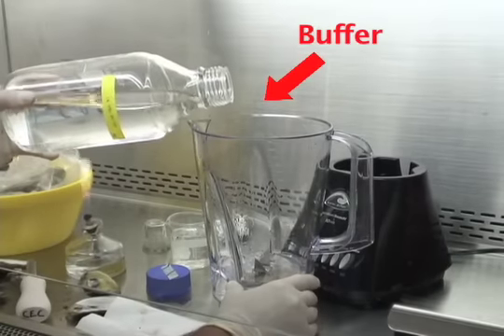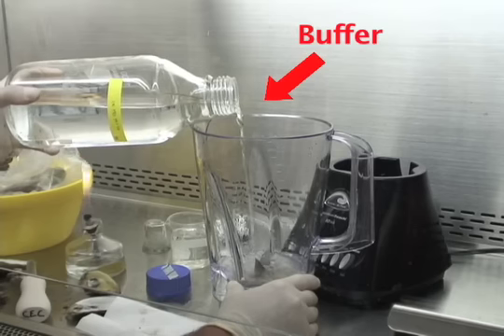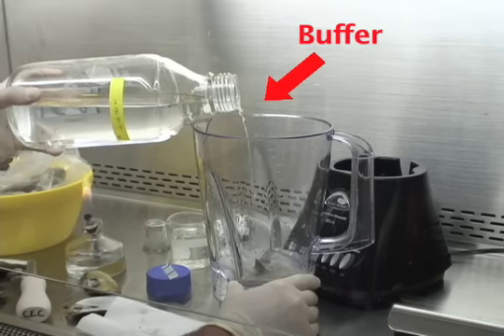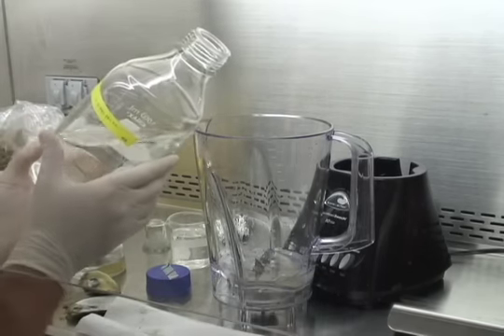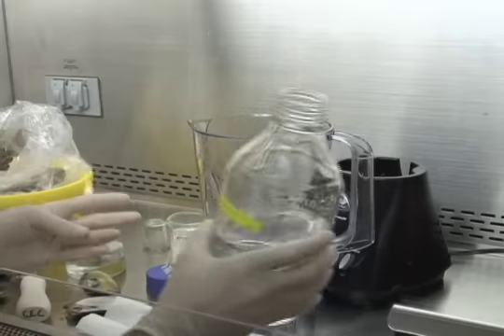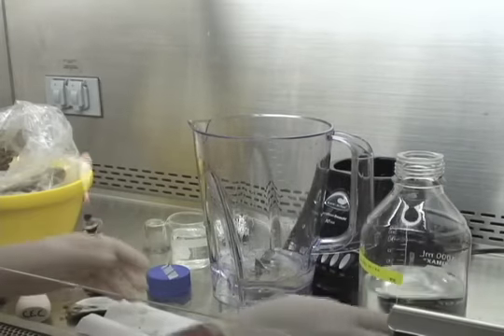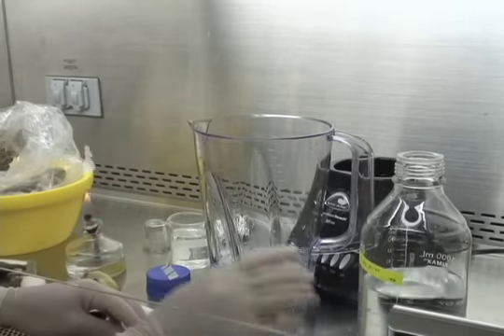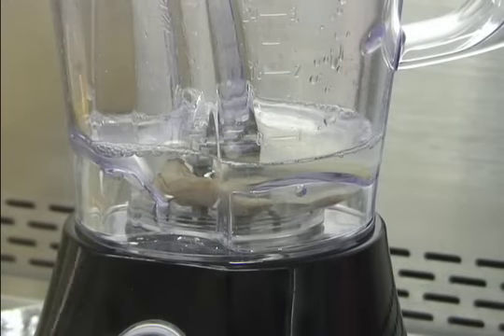Here we just have a buffer to make sure the bacteria are nice and happy. We're going to add 50 milliliters. And this is the real fun part. Blend them up for 30 seconds.